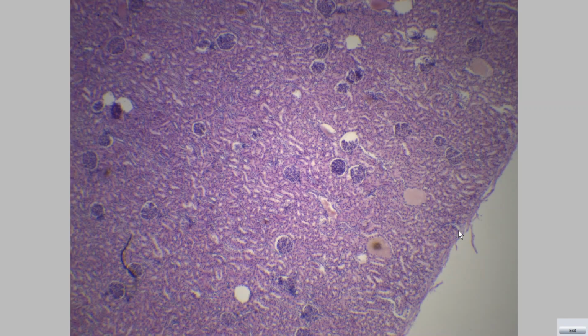In this lab, we will examine the parts of the urinary system. The renal or urinary system consists of the paired kidneys, the ureter, urinary bladder, and urethra. First slide is a section in a human kidney. Each kidney has a thin fibrous capsule.